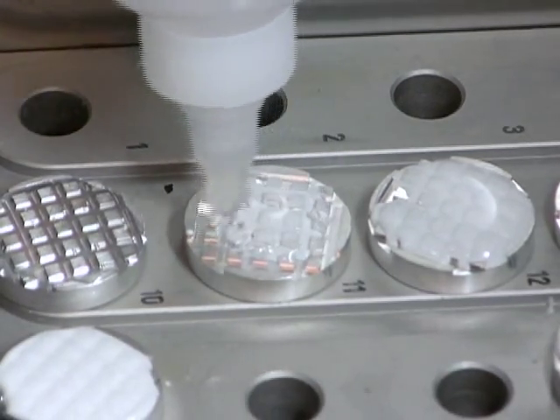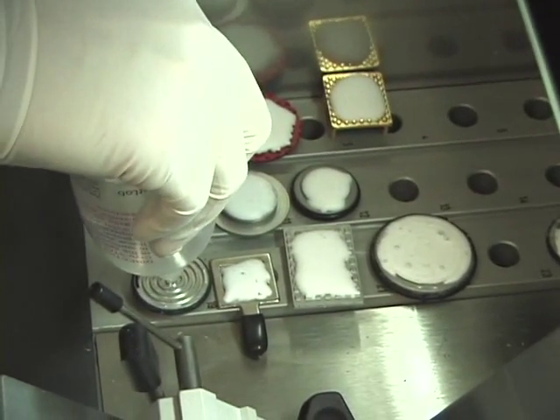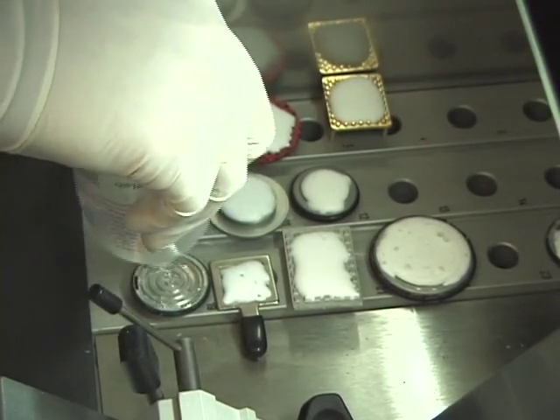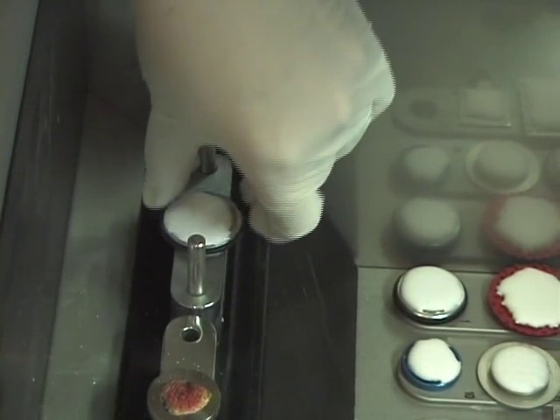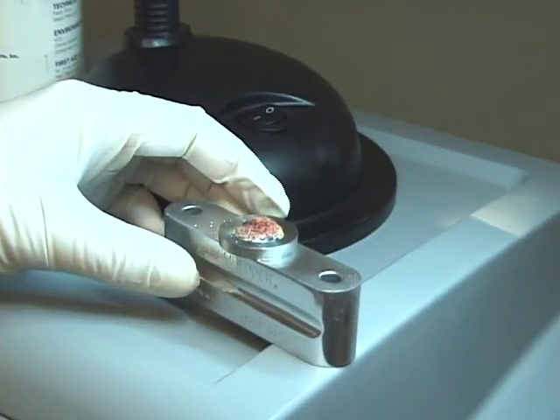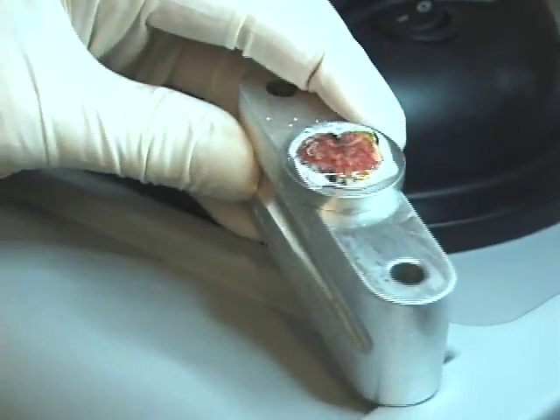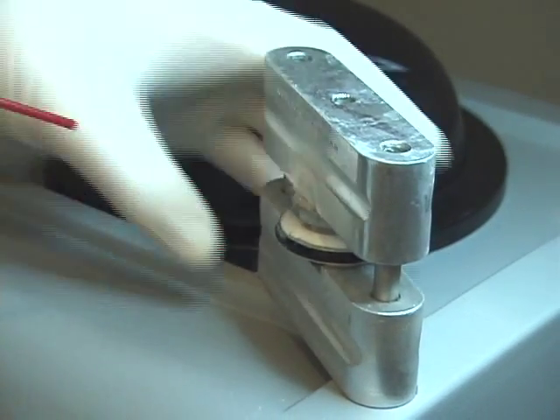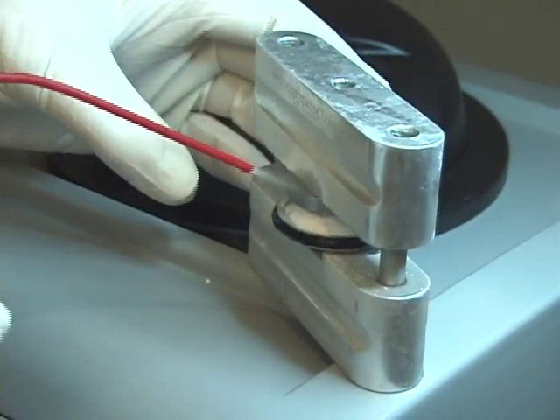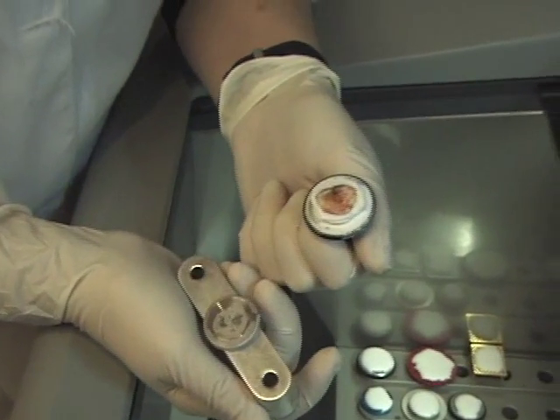Cutting chucks should be prepared with embedding medium while they are warm so the medium can fill in the grooves for gripping power. The Microm chuck fits into the center hole of the bottom section of the embedding device, and the flat disc with the frozen specimen fits into the center hole on the top section. The specimen is covered with embedding medium; you can see how the medium has already begun to freeze as the temperature of the embedder is conducted into the specimen. It is immediately turned over onto the cutting chuck, keeping the specimen securely in place, then lifted outside the chamber to apply freeze spray while rotating the discs. The top portion is then lifted off with the discs.